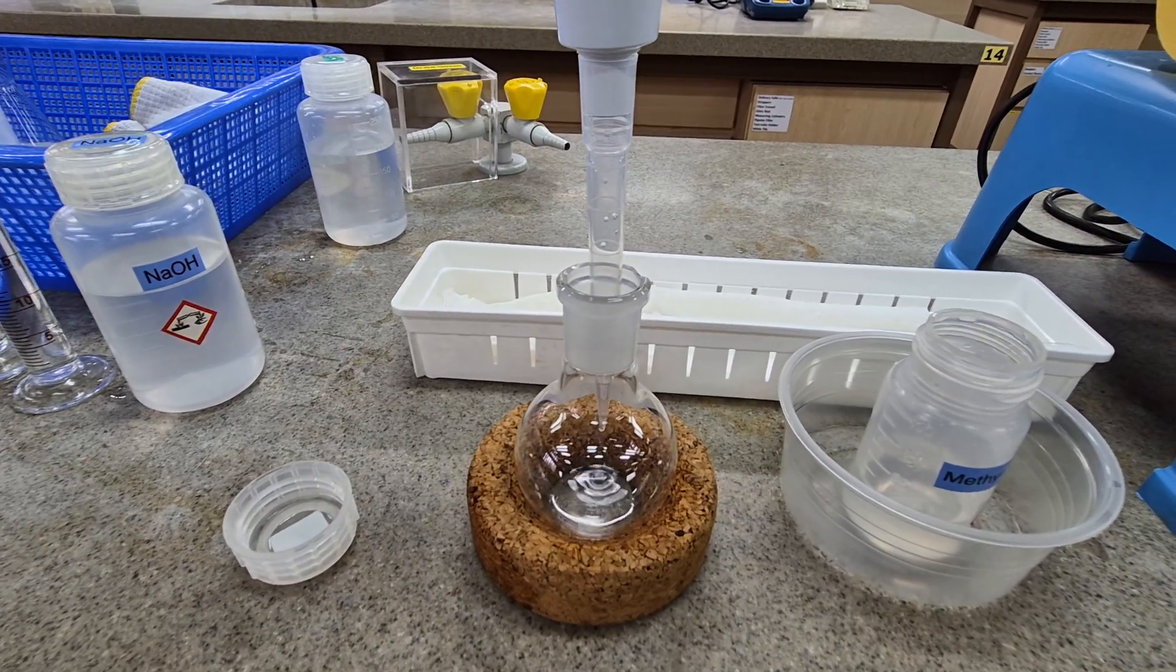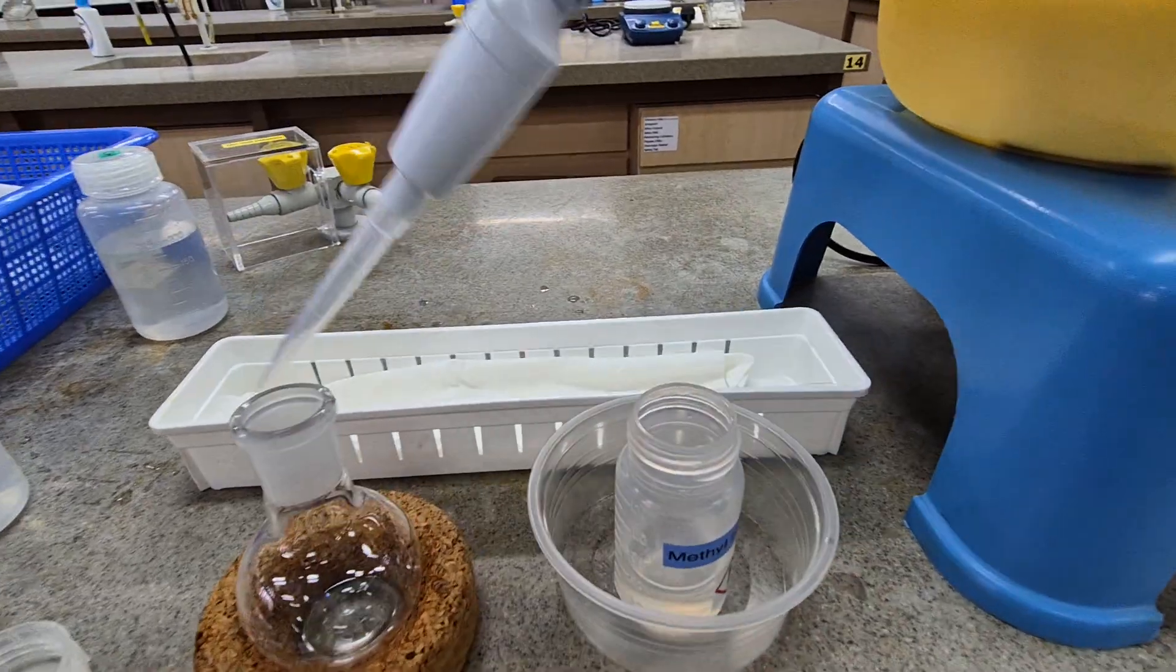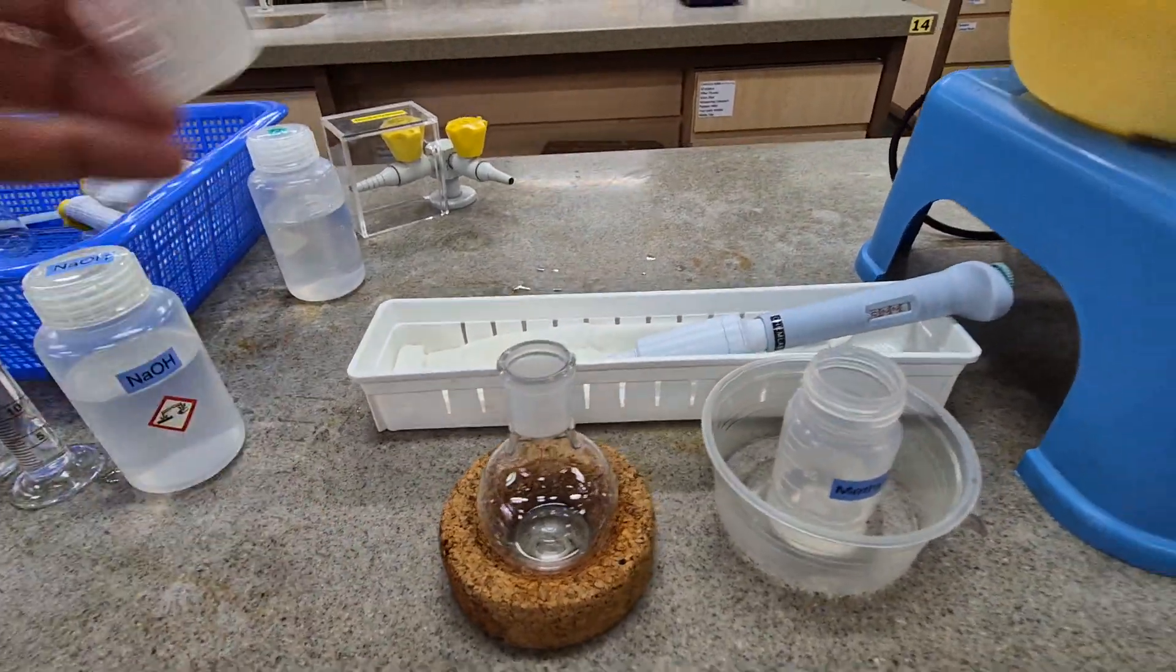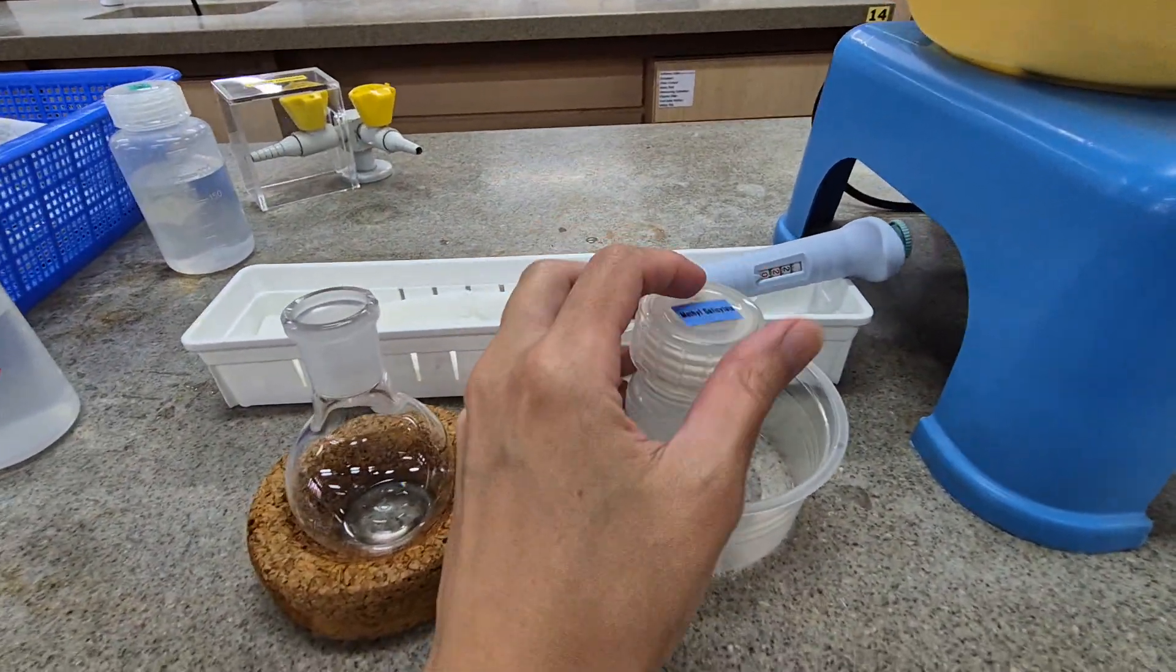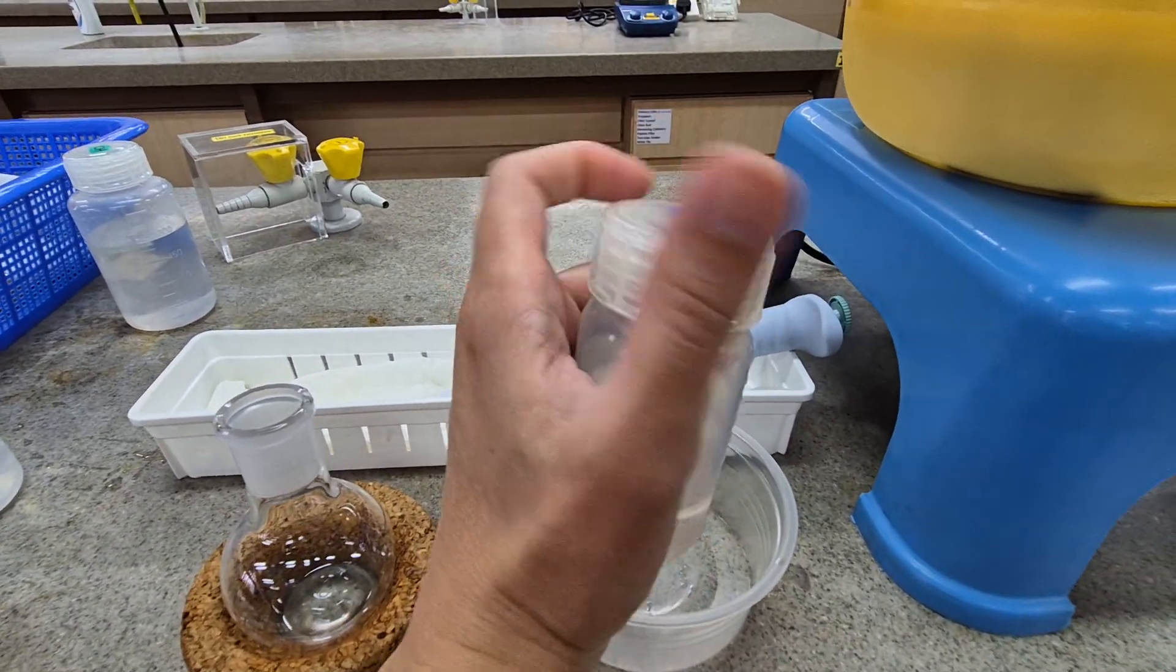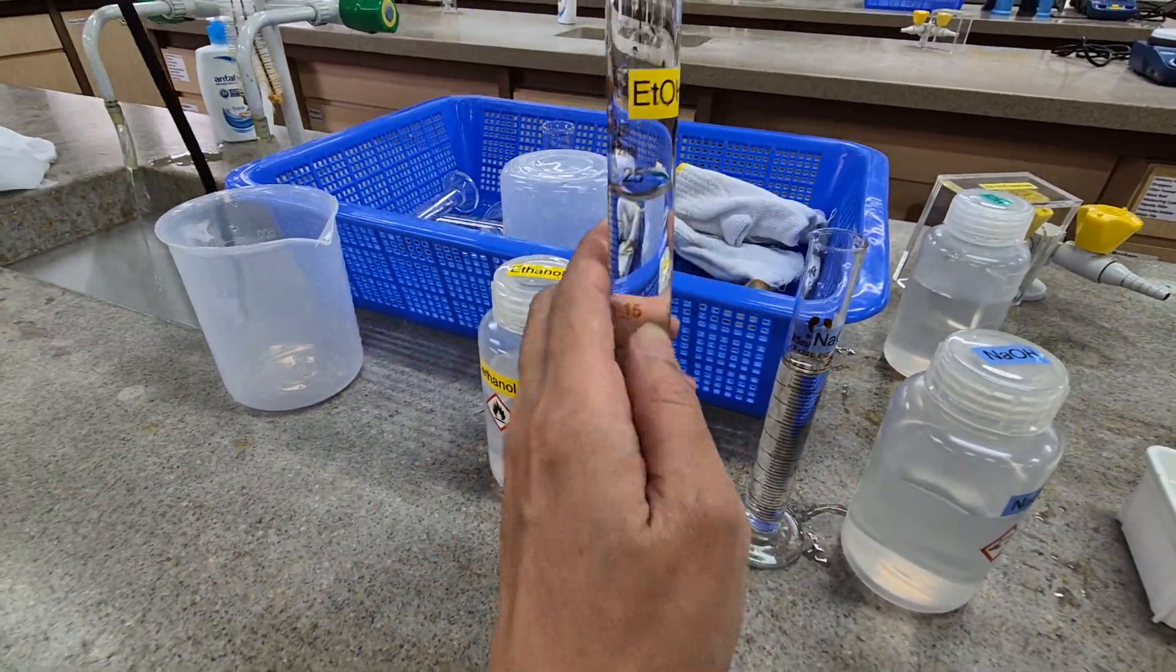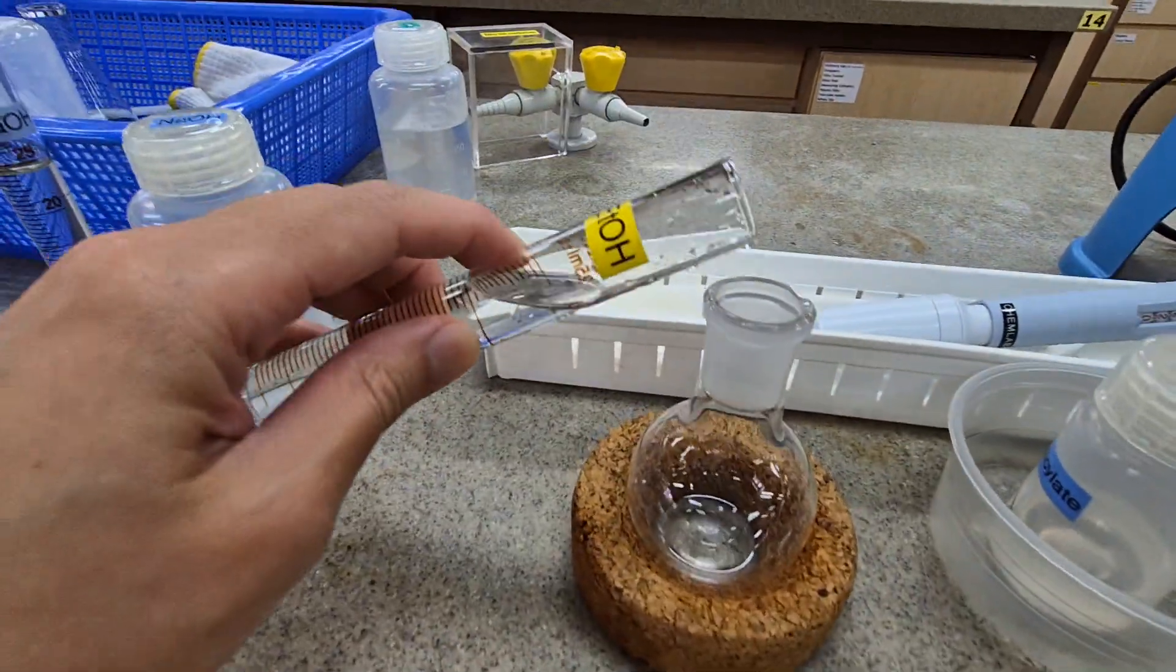Slowly. Then I'm just going to put back the cap. Remember all the good habits - you should cap it back. After that, I'm going to pour the solvent. In this case, ethanol. I've already poured in earlier, so I'm just going to introduce it in.